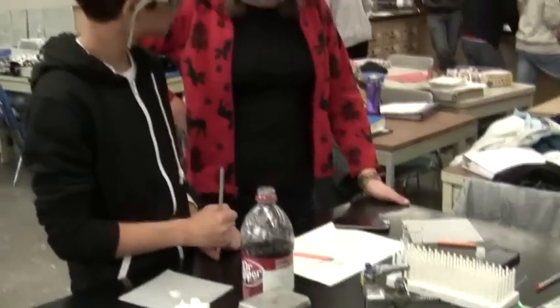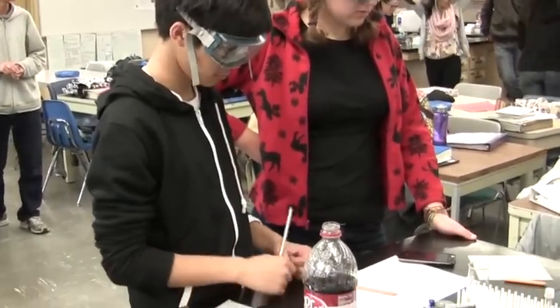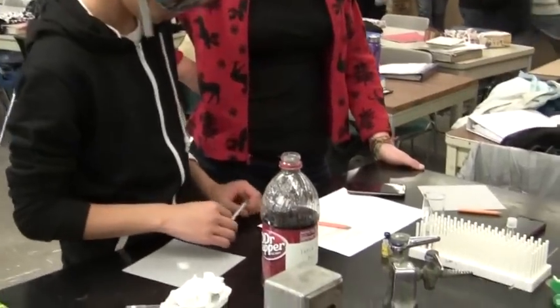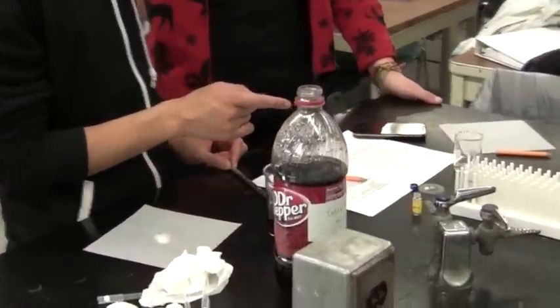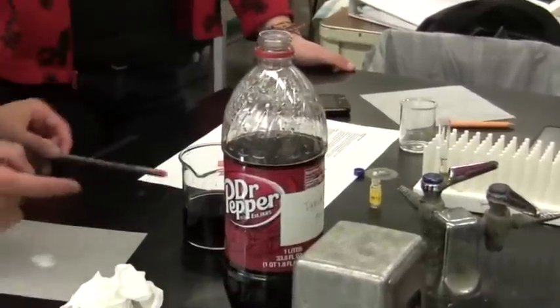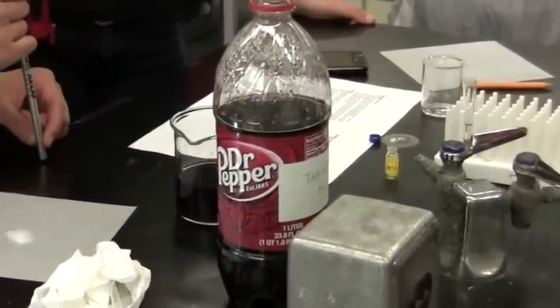What's different is integrating something that students can actually tangibly see and that they use every day, like a soft drink. A lot of what we do in chemistry is abstract, but here they can actually see it hands-on, see the data, and observe the tangible results of something that might affect them on an everyday basis.